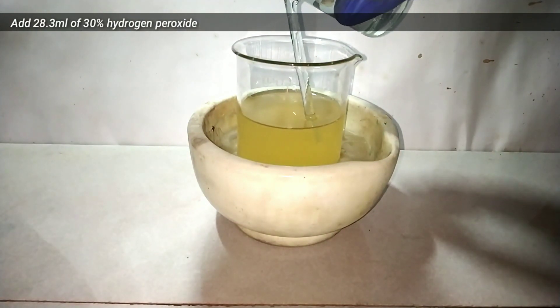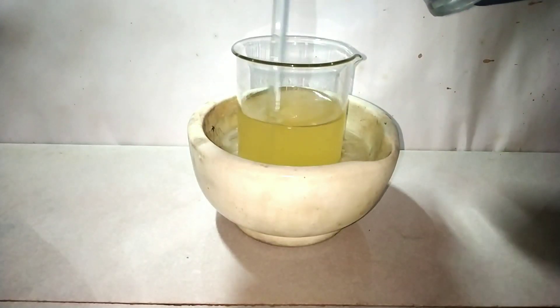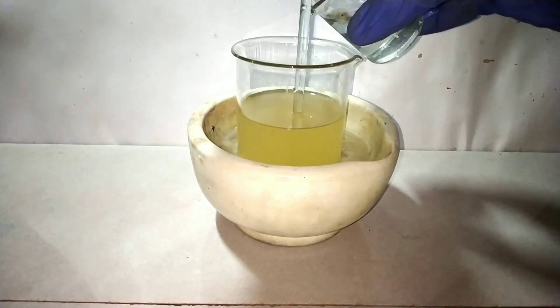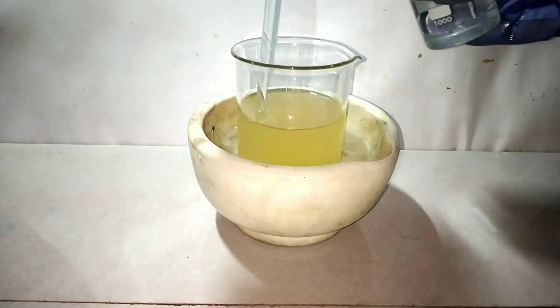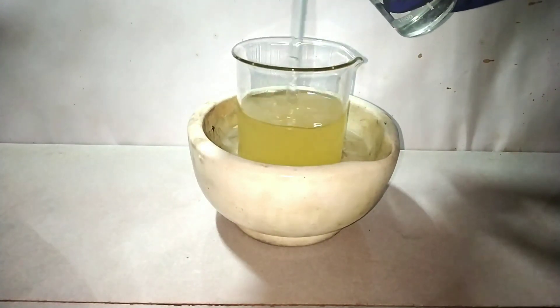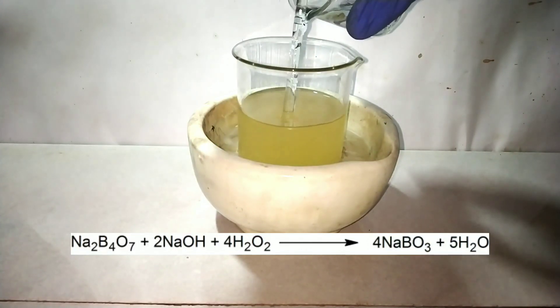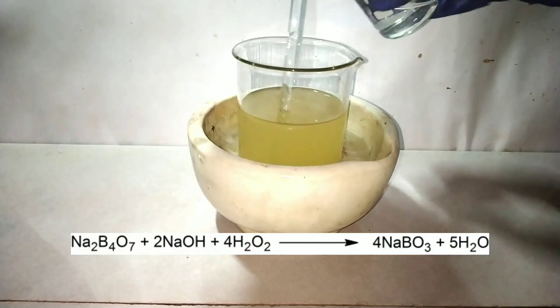After cooling, add 28.3 ml of 30% hydrogen peroxide into this mixture slowly with stirring using a glass stirring rod. We can also use 3% hydrogen peroxide, but we should do the stoichiometrical calculation and add the exact amounts. The reaction taking place is: sodium tetraborate reacts with sodium hydroxide and hydrogen peroxide to form sodium perborate and water.